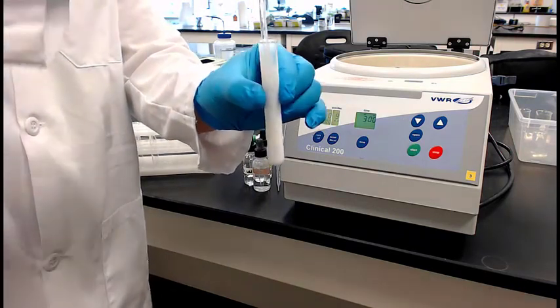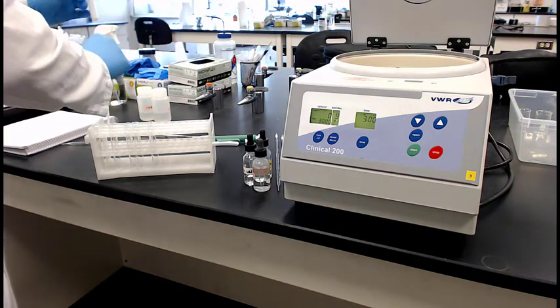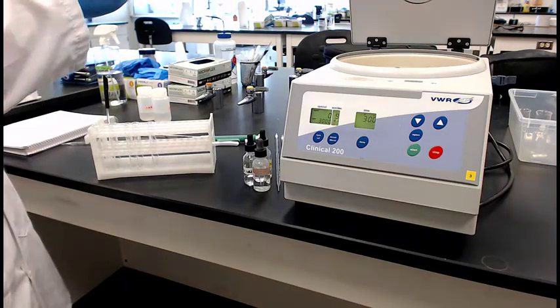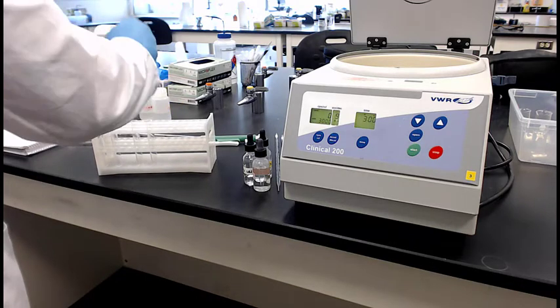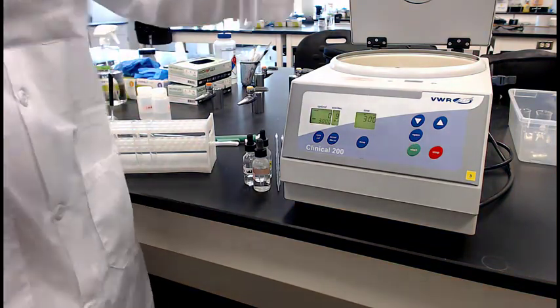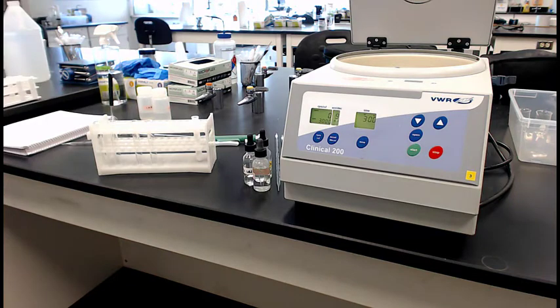Right? So if you look at your balanced equation, it tends to run left because the K is very low, so it makes a lot of the solid calcium carbonate. So it makes a lot of white precipitate. Can't quite see what he's doing. There we go. Oh yeah, so he's just trying to show you, look. Clear solutions, when you mix them together, you get this solid white milky precipitate.